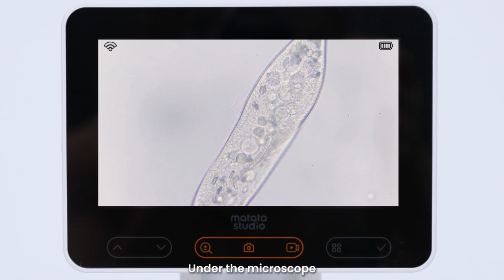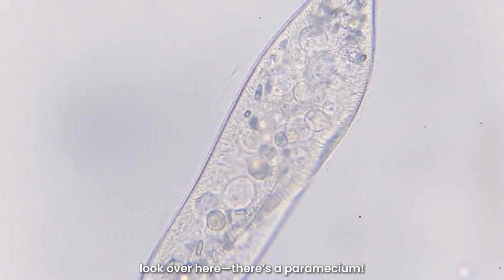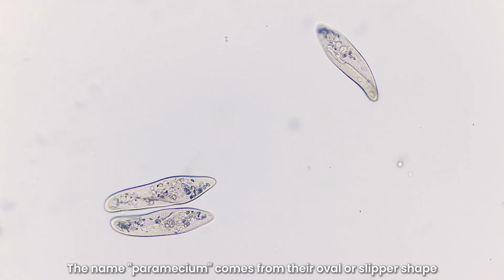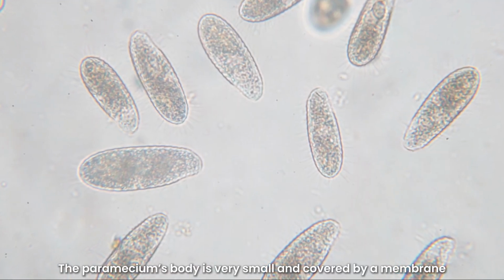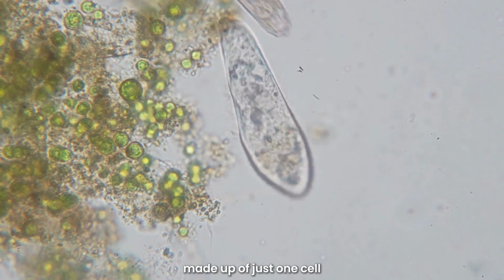Under the microscope, we can see some impurities and algae. Everyone, look over here, there's a paramecium. The name paramecium comes from their oval or slipper shape, and they move using tiny hair-like structures called cilia. The paramecium's body is very small and covered by a membrane. It's a typical single-celled organism, made up of just one cell.